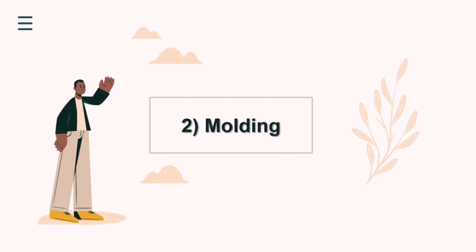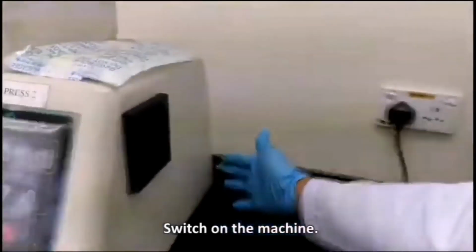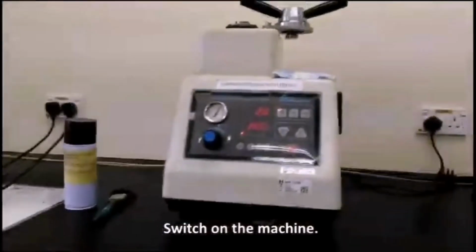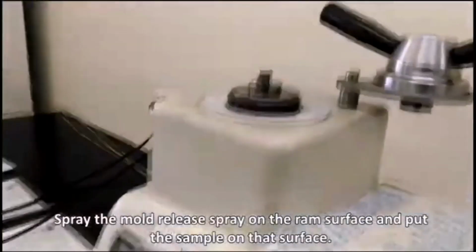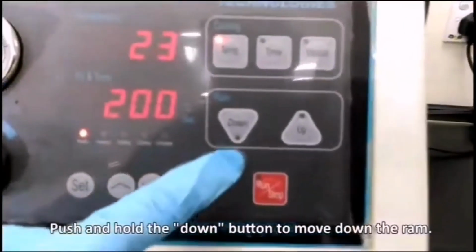The next one is molding. So I got this from somewhere. It is a sample of the real procedure of sample preparation. I'm not sure how to mold because it needs heat and some chemical substance. We use phenolic powder to mold with the steel.